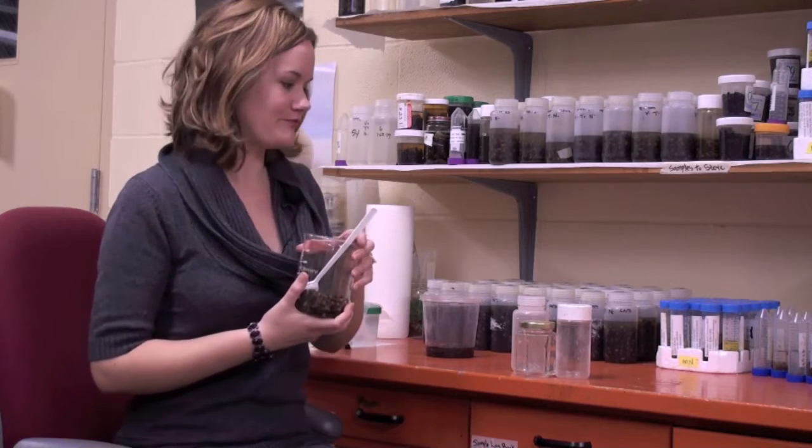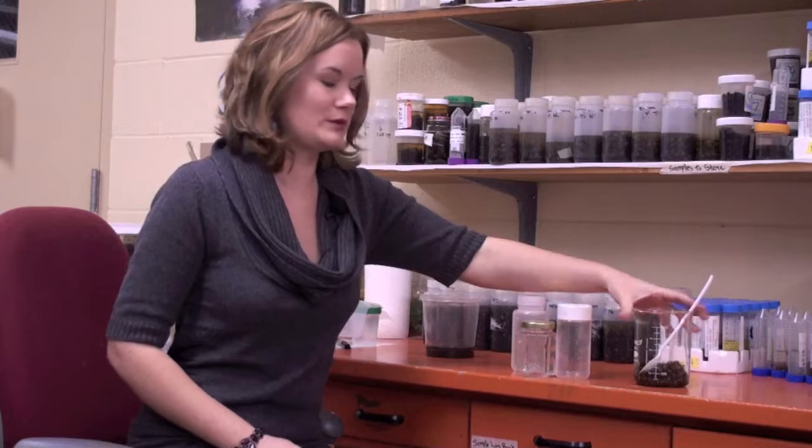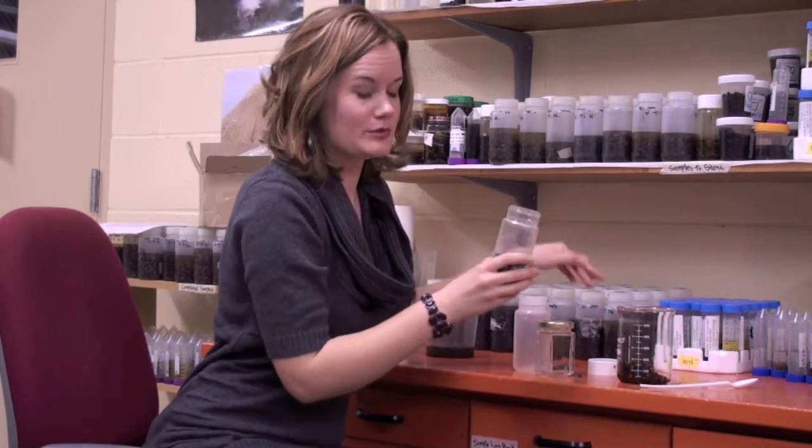And so when you go out and sample in the field, and you get bees, so I've skipped to the point where you've already collected your bees, you're going to have dry, dead bees at this point. So you're going to be putting them into a container with alcohol. So we're going to use this container. I need about a half a cup to a cup of bees.